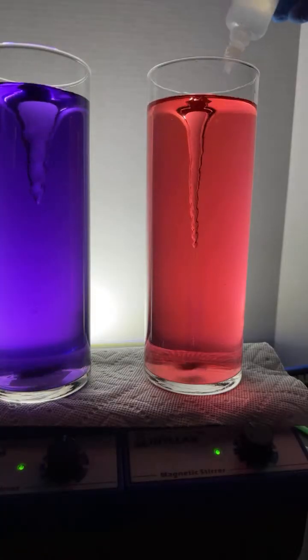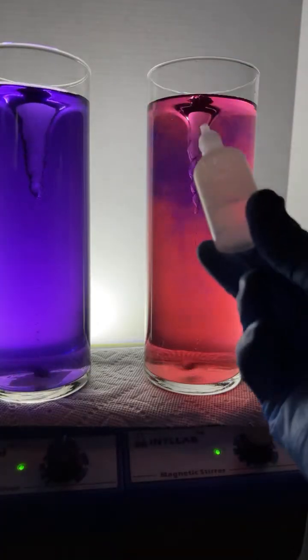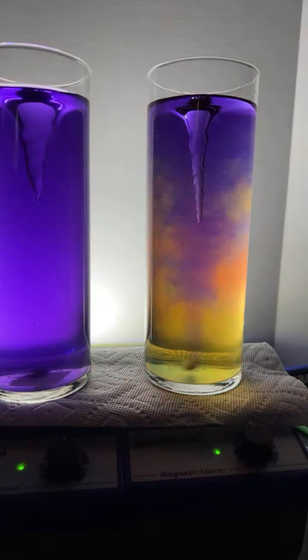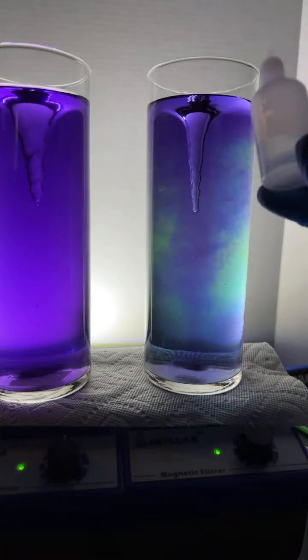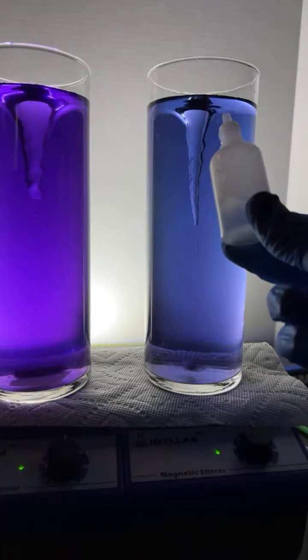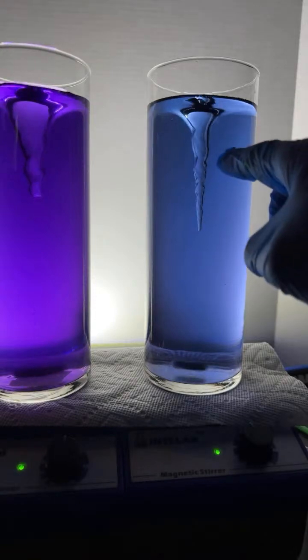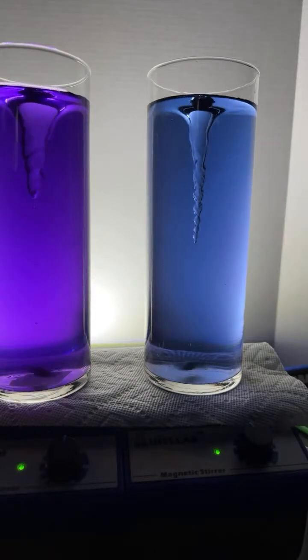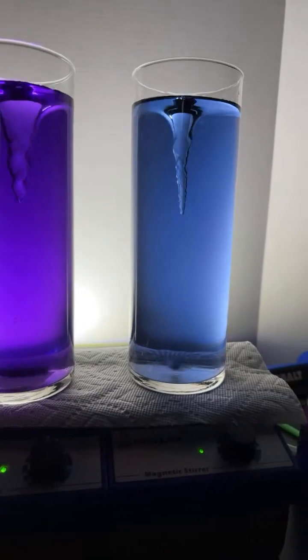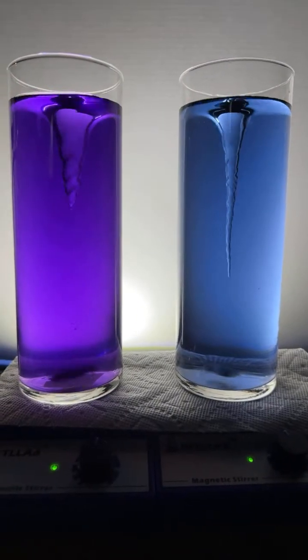And because I know the chemistry, the chemical reaction of sodium hydroxide reacting with the acid that's present, by knowing that, there it is, I neutralize it. I actually went a little bit too far. But since I know how much of this I added, I can figure out how much of the acid was originally present. That's the way titration works. I hope that's clear. I was trying to go for green here, but I overshot and went to blue. That happens a lot. 4 drops was it, man.